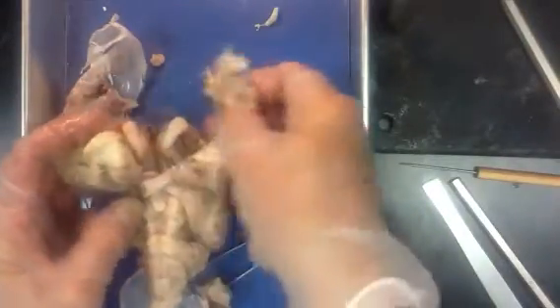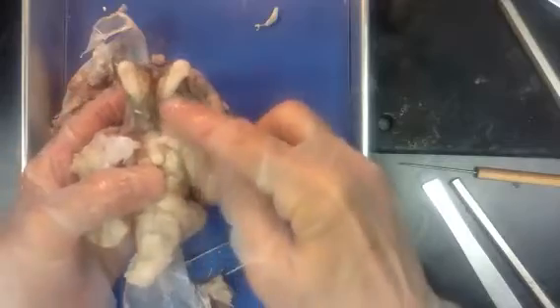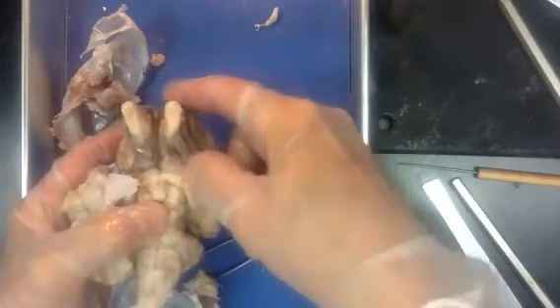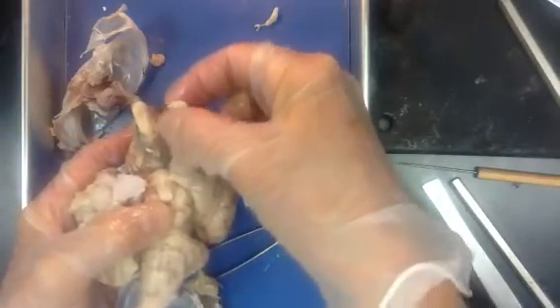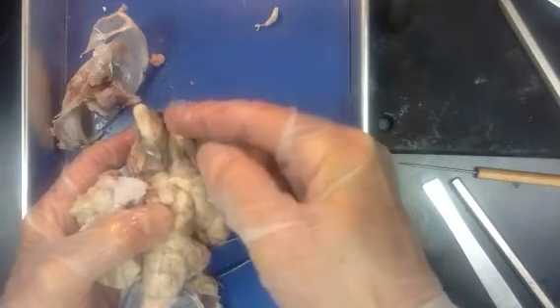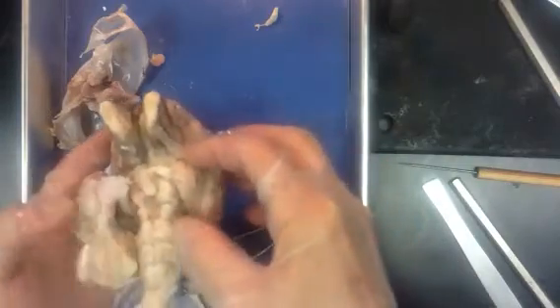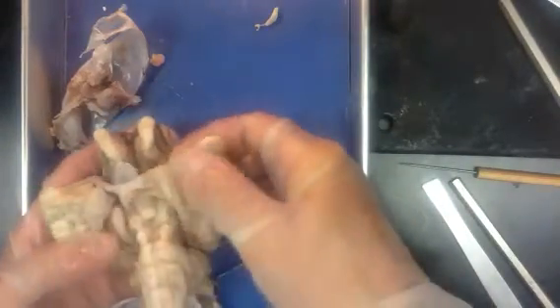If we flip the brain over and look at the inferior side, I'm going to put this aside just for a moment. What we can see coming out the front are very, very well developed olfactory nerves on sheep, which are very dependent on their sense of smell. They have a better olfactory tract than we do, more developed. Their optic nerves are quite well developed.